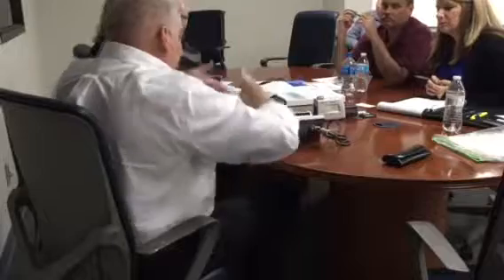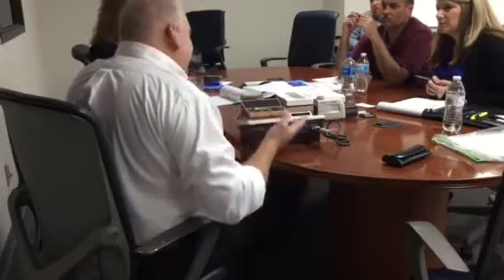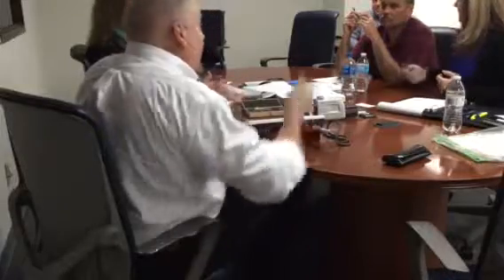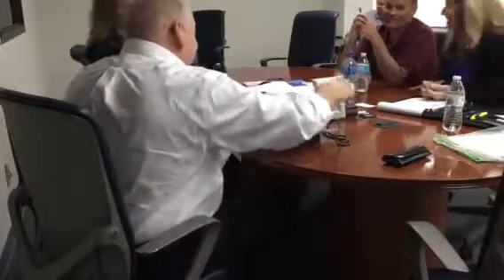Right now, it's a nice cone-shaped diamond tip, okay? As you use it, it's gonna wear out. Really, it comes down to how it's being used. Somebody shoving a piece of paper under it, dragging it around. That's what's gonna damage it. I don't wanna say misuse, but inadvertent use, like pulling the specimen out without lifting the stylus up.